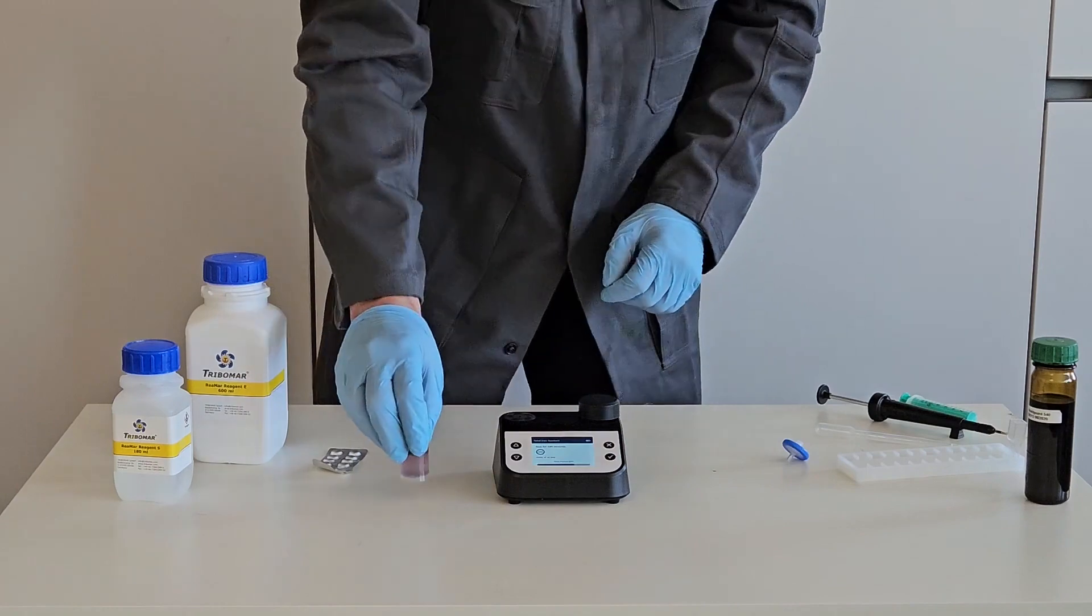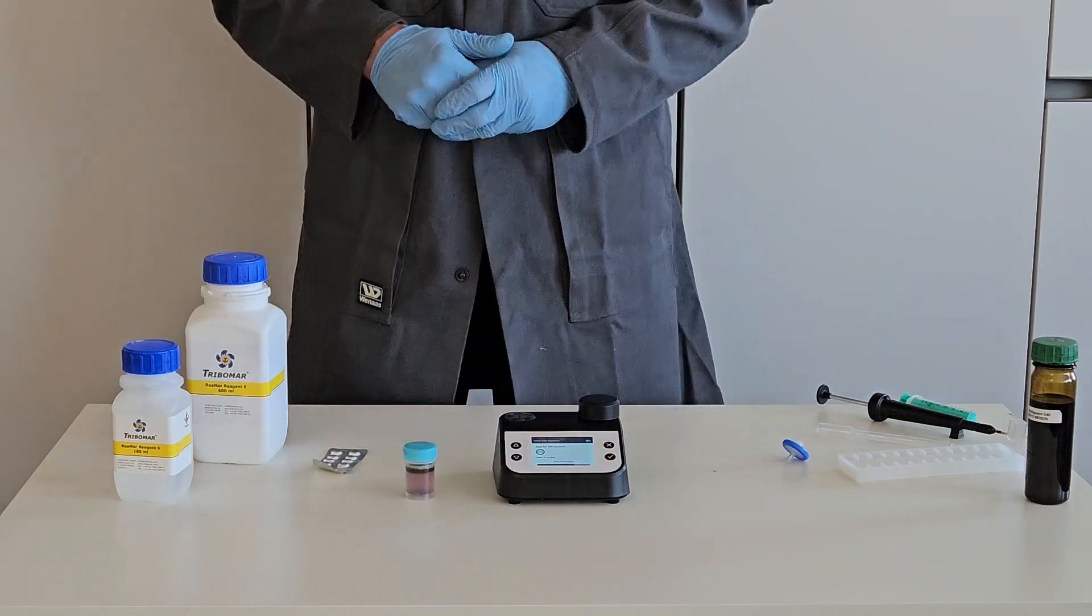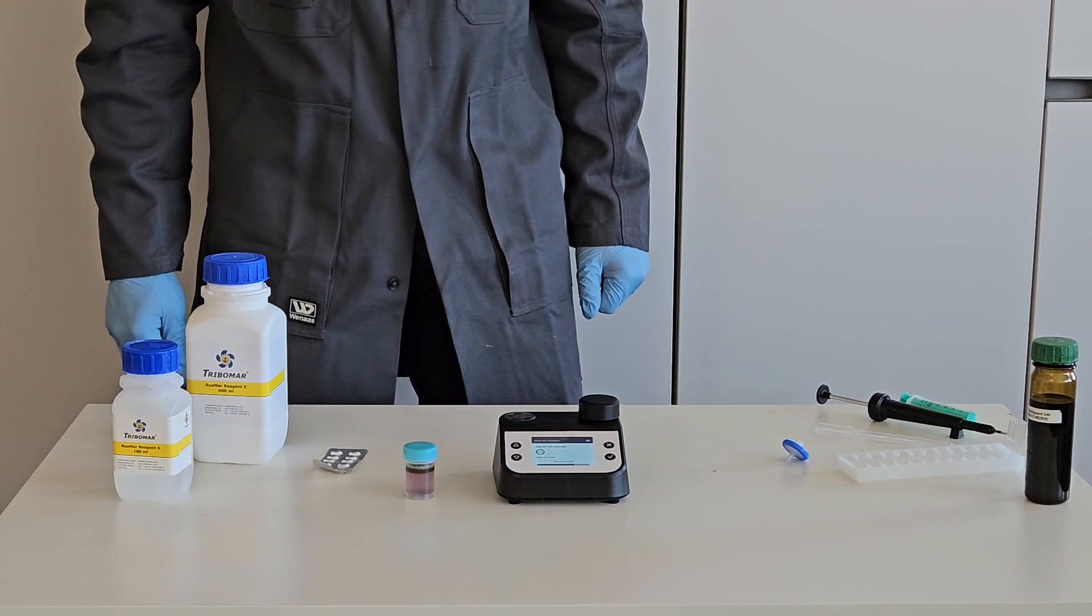Afterward, 480 seconds rest period starts automatically. Optional, the timer can also be skipped.